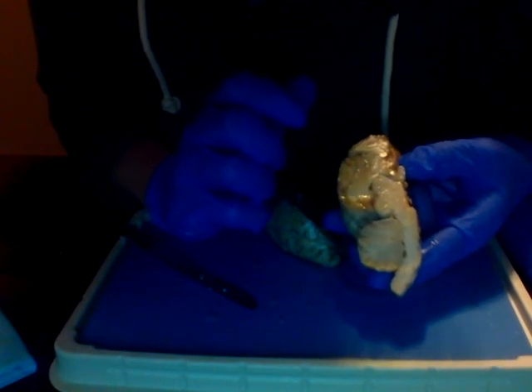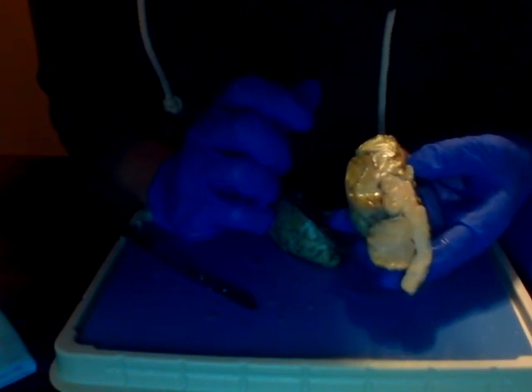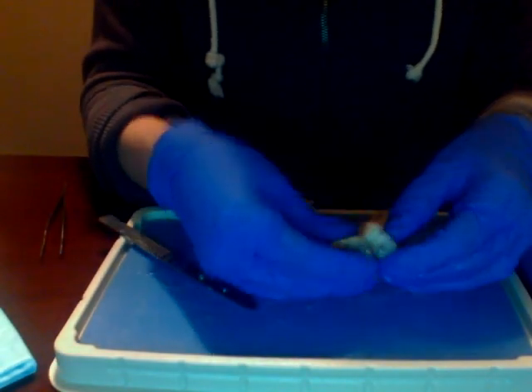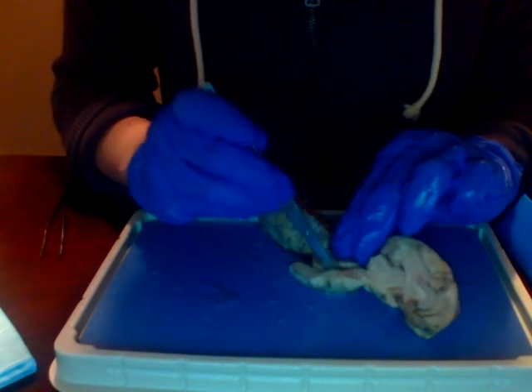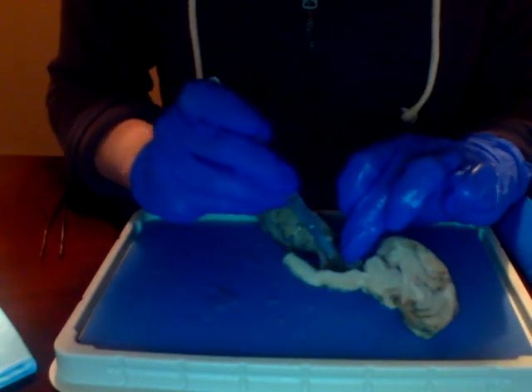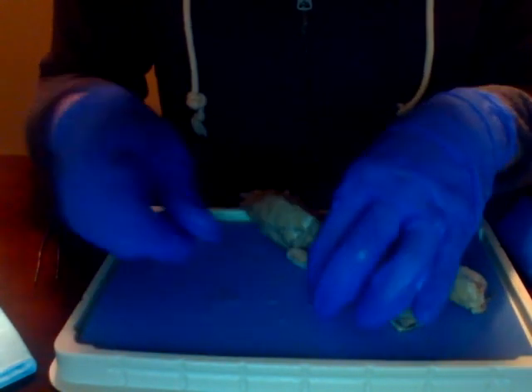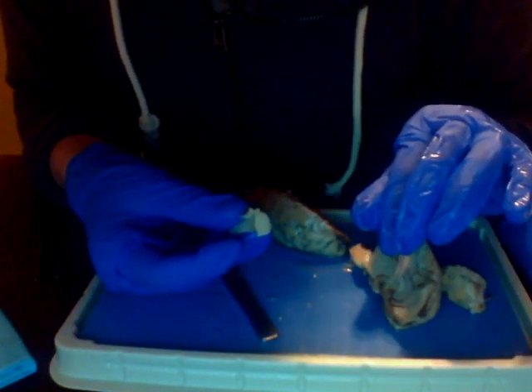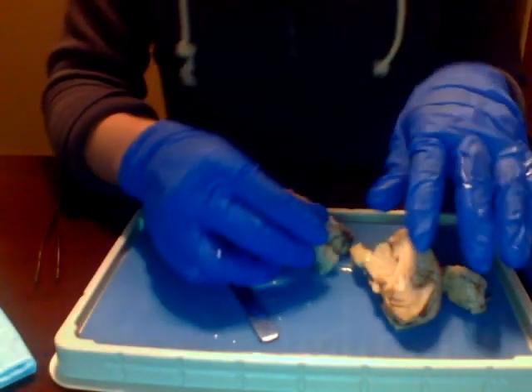Slice a small cross-section of the spinal cord. Note the classic butterfly-shaped section of the gray matter and the dorsal and ventral roots on the outside of the spinal cord. So I'm going to detach the cerebellum, so I can just take a piece of the spinal cord. Dispose of the brain specimen appropriately and disinfect your work area. All right.